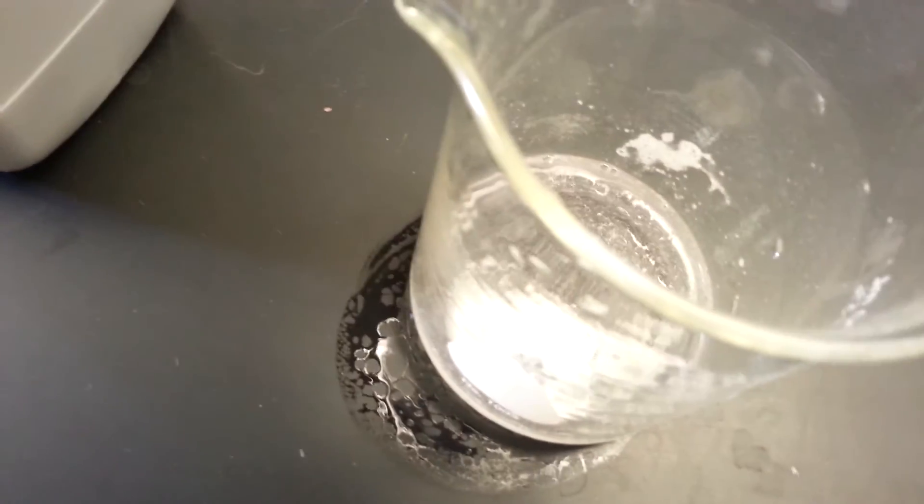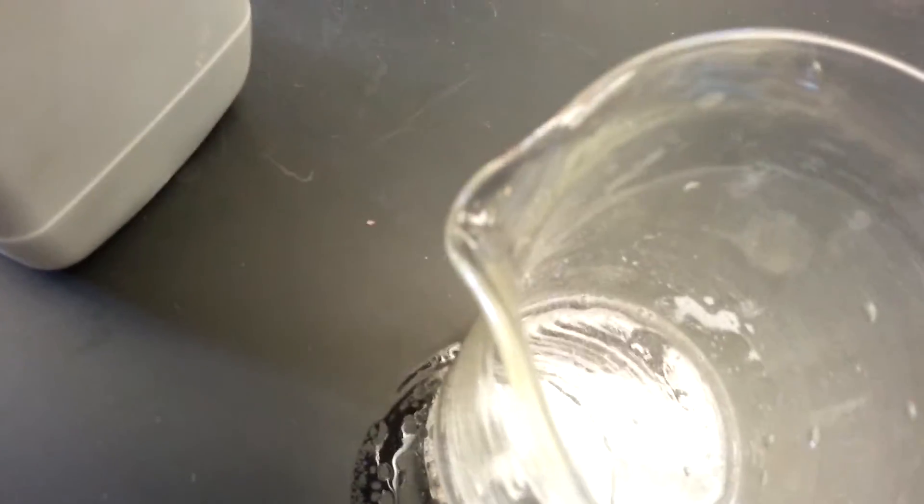This is basically what happens when you combine the two. You see there's still some sodium bicarbonate in there—that means the sulfuric acid is pretty much neutralized.